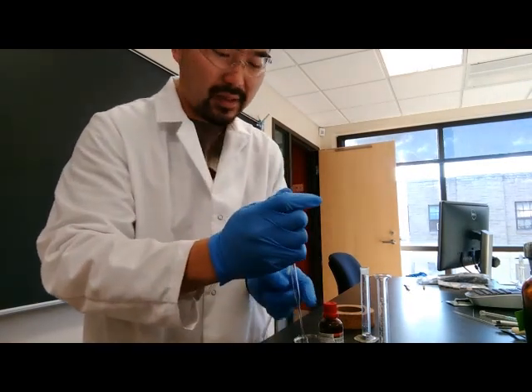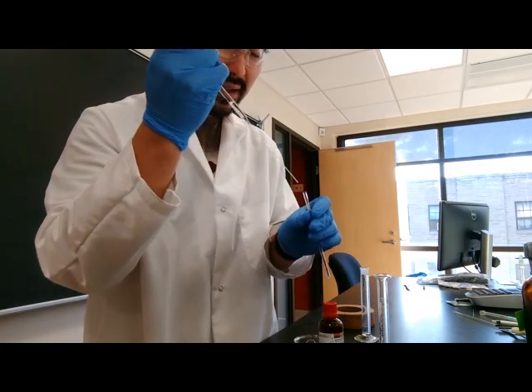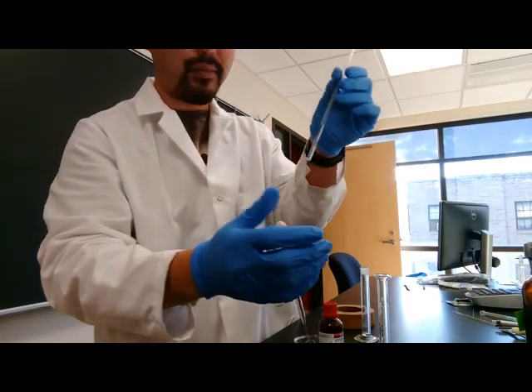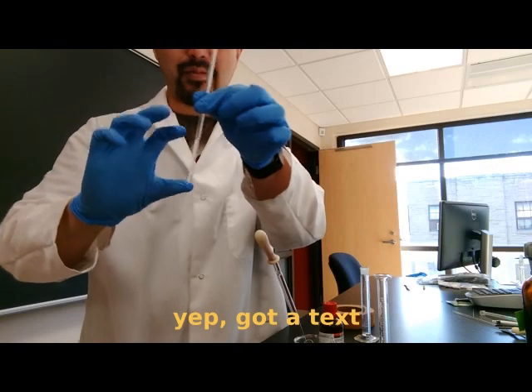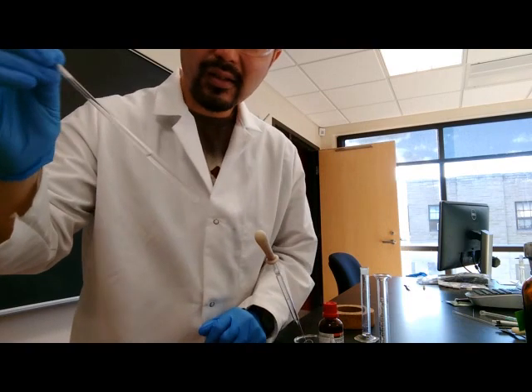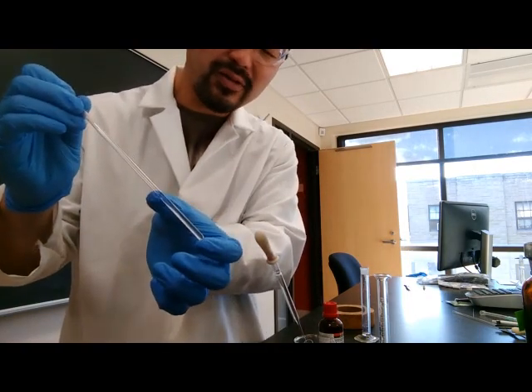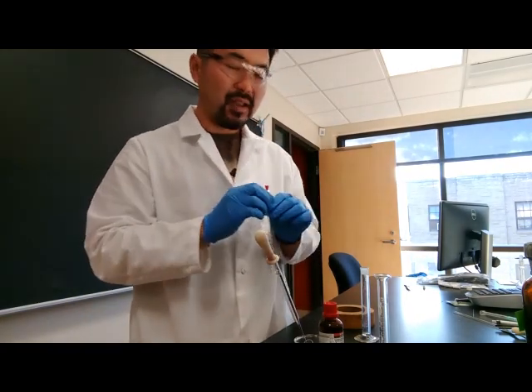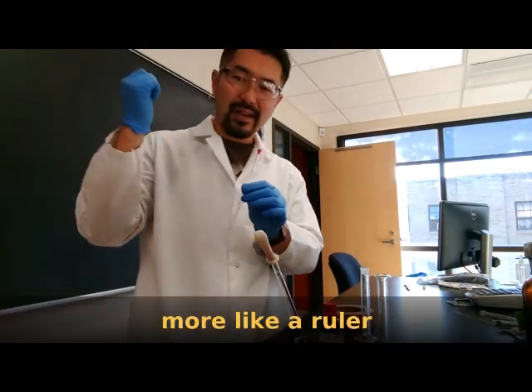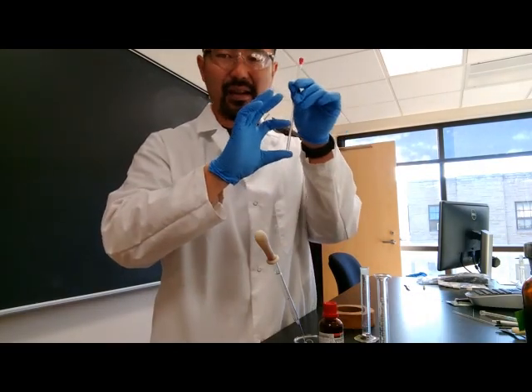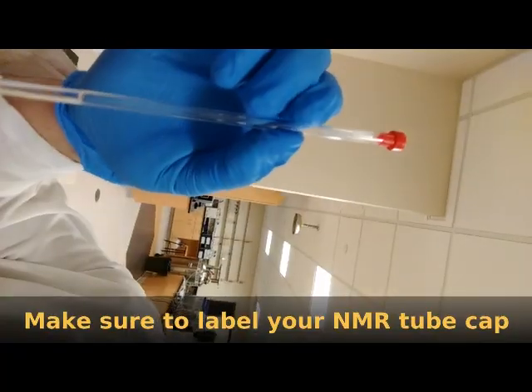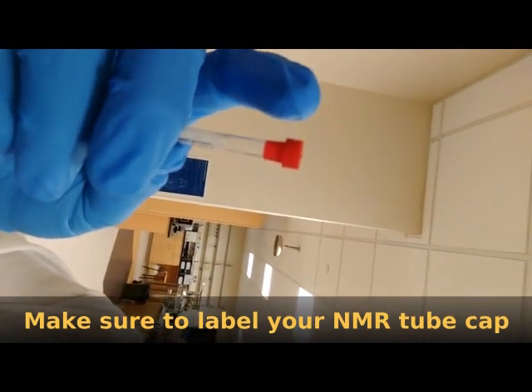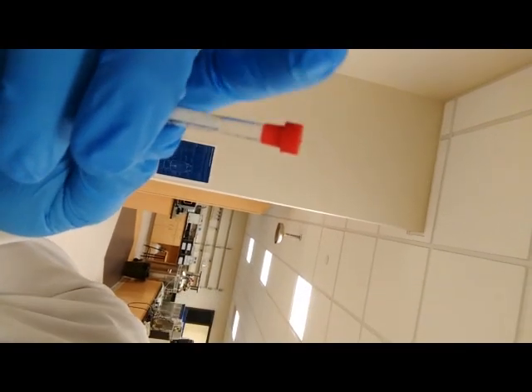After you have made your NMR sample solution, you can take that up and fill your NMR tube with it. And you need about 0.7 to 0.8 milliliters to cover about that much of the NMR tube. So this is almost on the too much side, but you need about at least about that much of a liquid in the NMR tube. And if you're not sure what the height is, there's a gauge right by the NMR spectroscopy instrument that tells you how high the sample height needs to be. Make sure that your NMR sample tube is labeled. This would be a good place to label with marker right here on the top, the cap for the tube.